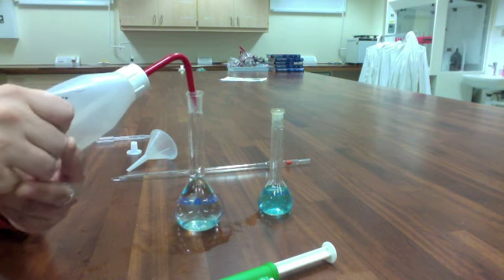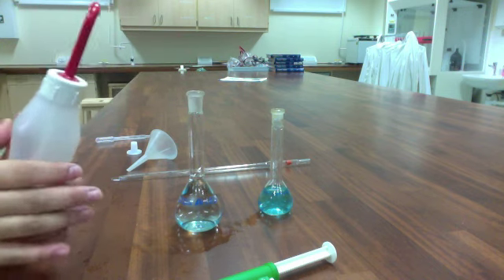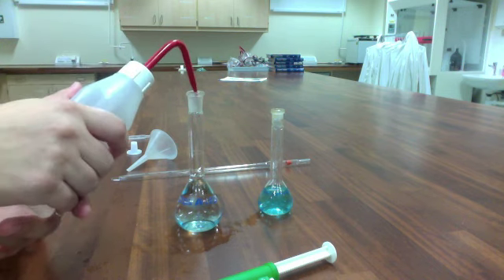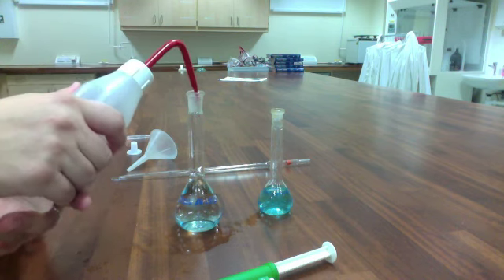And again, we want to deliver until it's just under. And watch, as soon as it gets into the neck of the flask, things start to go up very quickly. Getting eye level with the mark, and adding the last bit drop by drop.